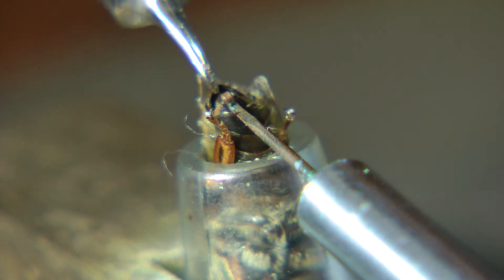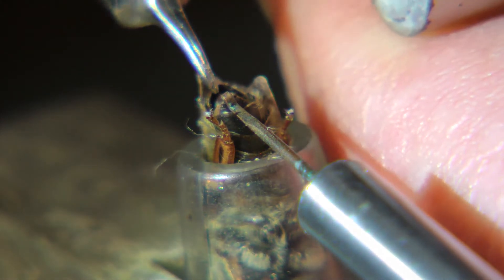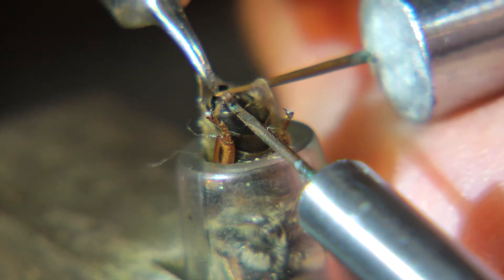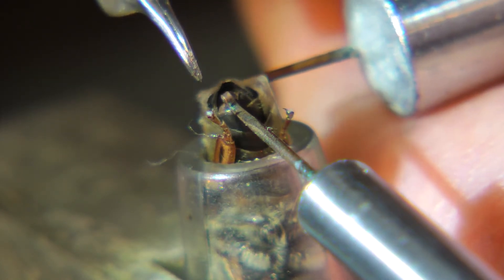Did you try to clean it now? Yeah, I did. Now I've got to go back and find that stinger. He wants to grasp the stinger with the forceps. Where in the heck is the stinger? There it is.